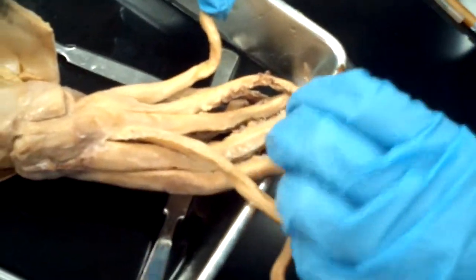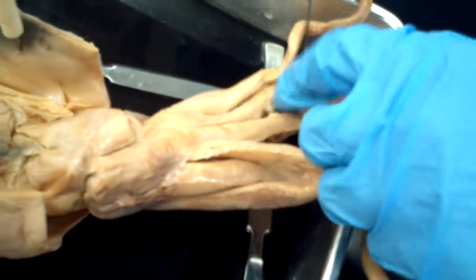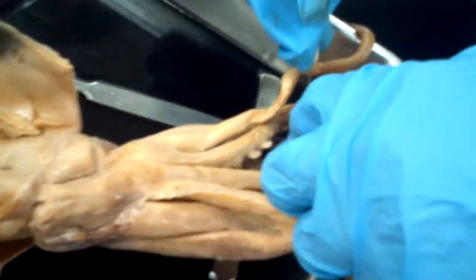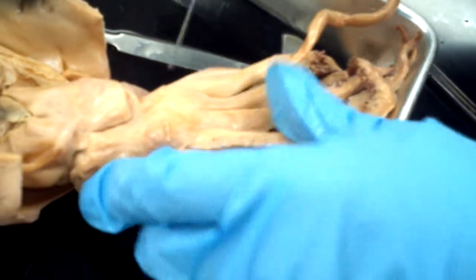One, two, three, four, five, six — so then identify the mouth and the jaw.